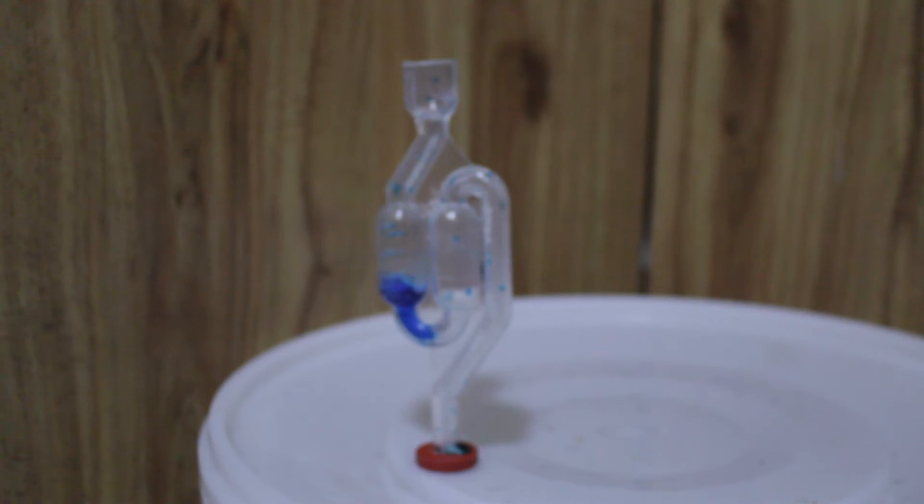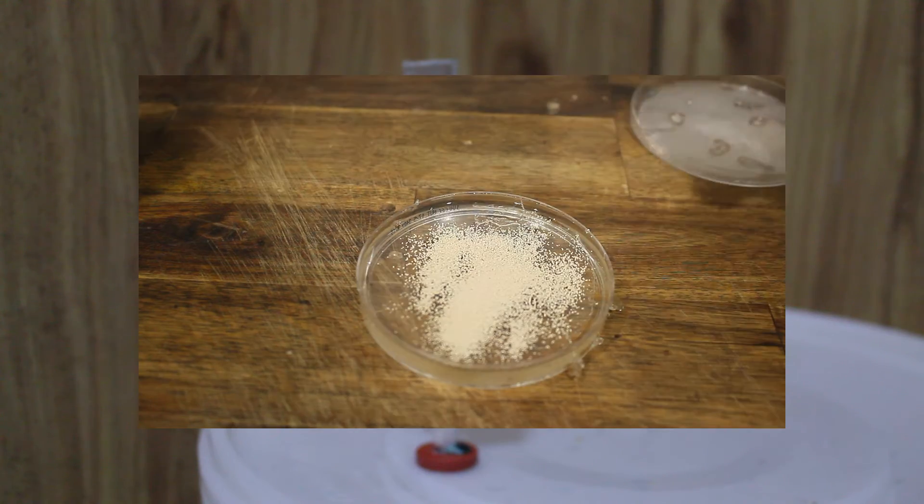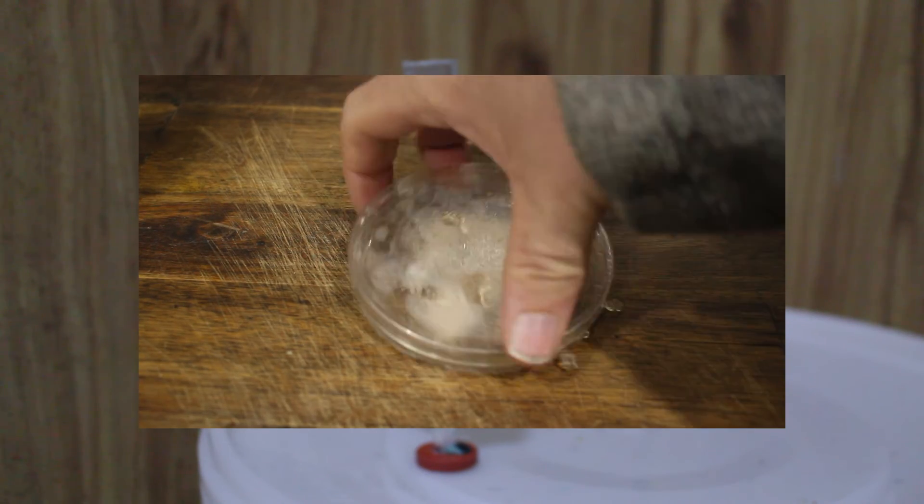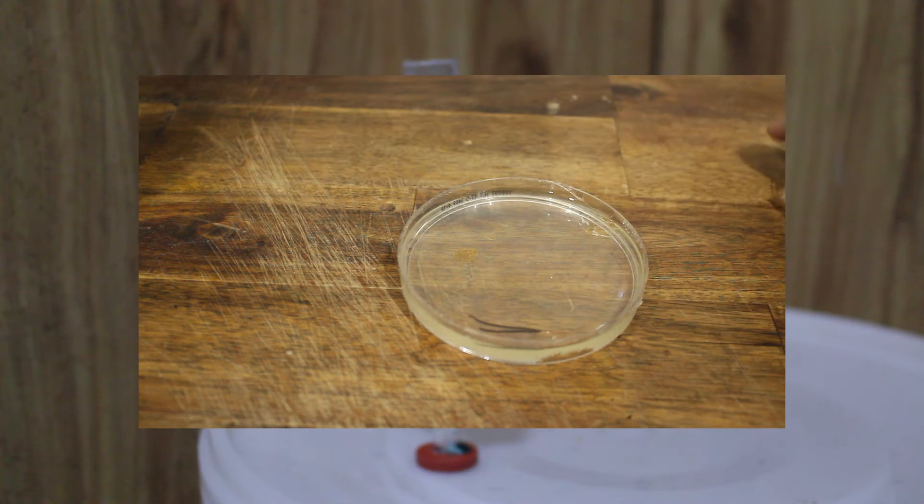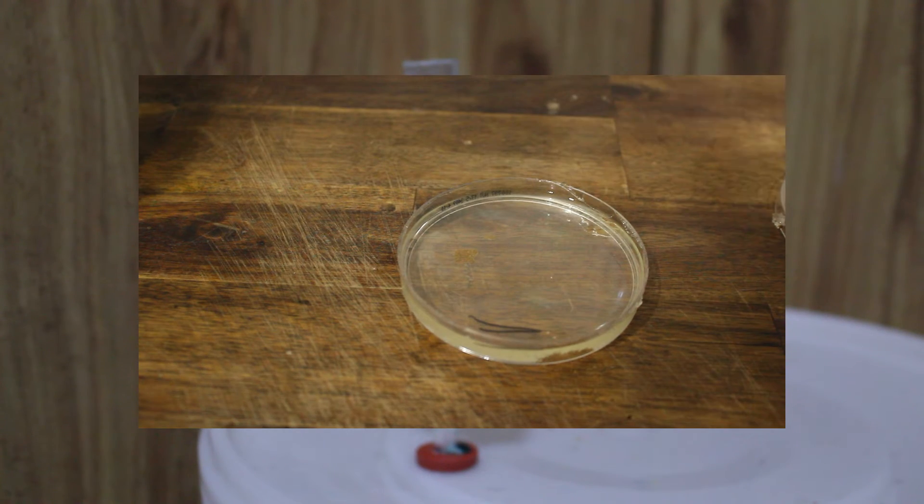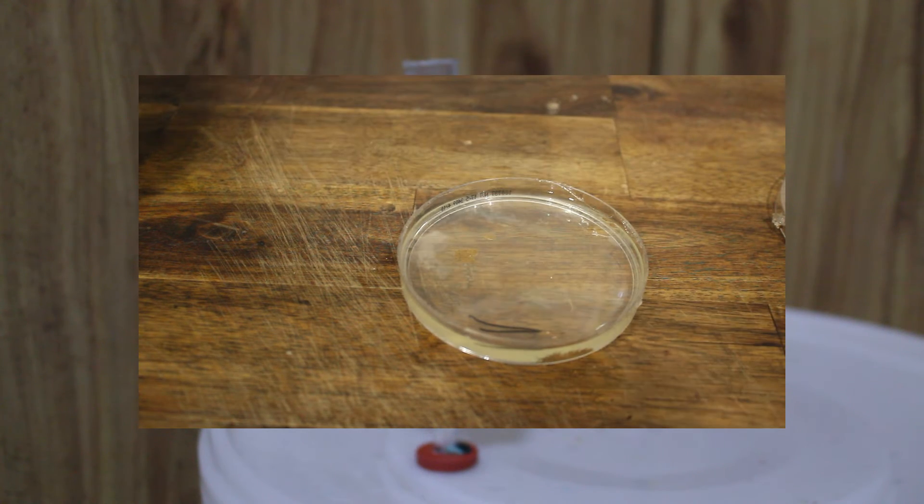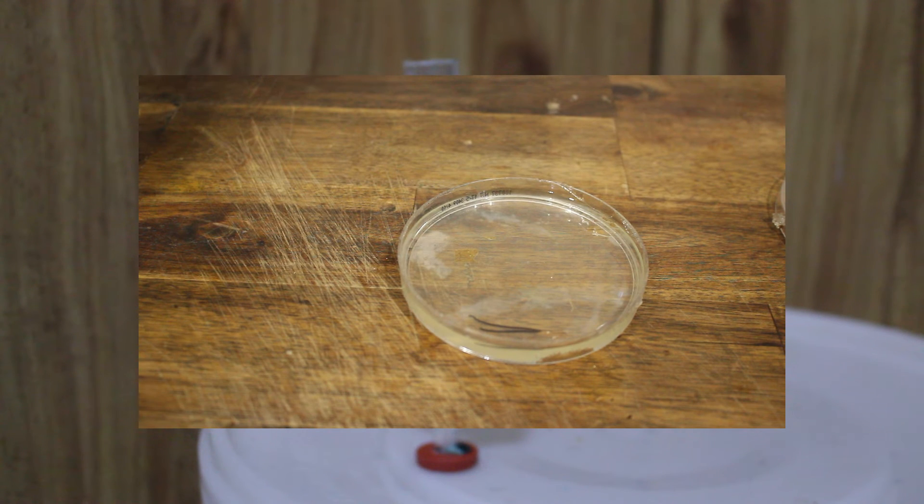And now for a more proper method. This involves making a sort of liquid culture of your yeast. First you do this and then you plate it. It's ideal if you want to culture liquid cultures to start with or you want to propagate a live beverage strain. Start with your agar as already described. This is adequate to grow your yeast initially.